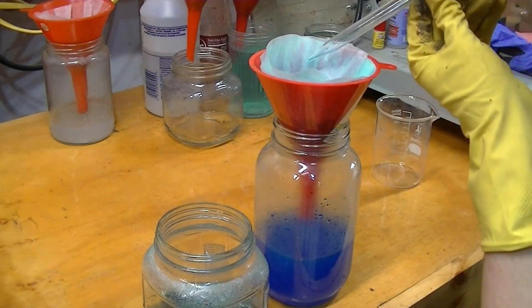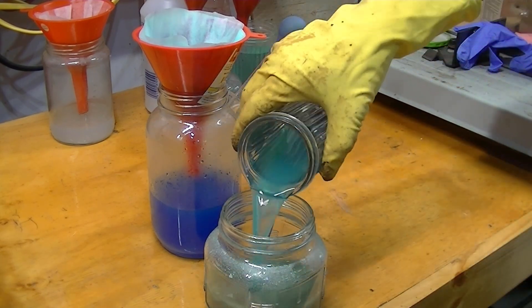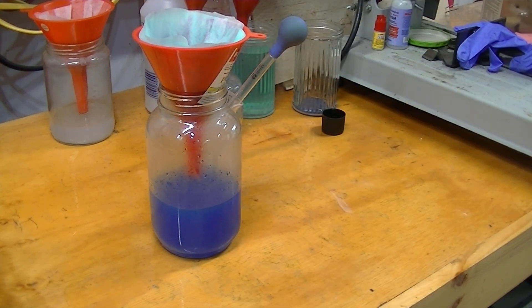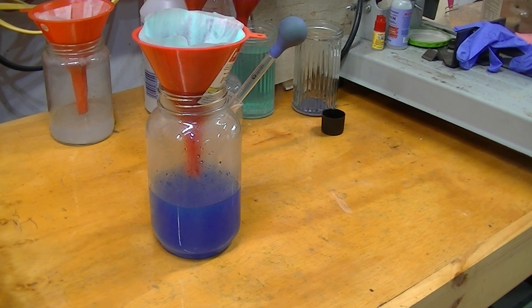Now that we've got all the solution out of the jar, I put in more solution that has not had the silver removed from it, so we can do the cycle one more time.